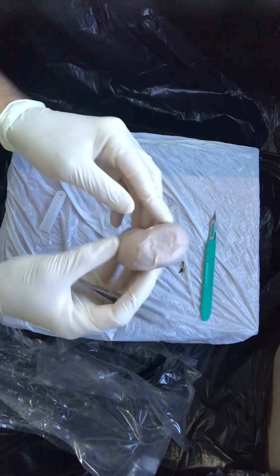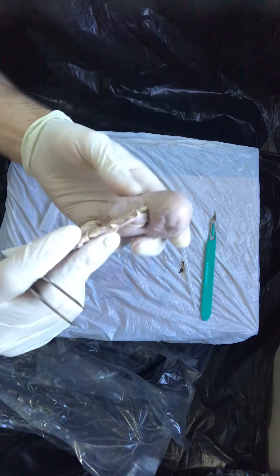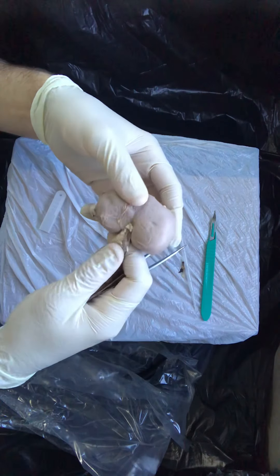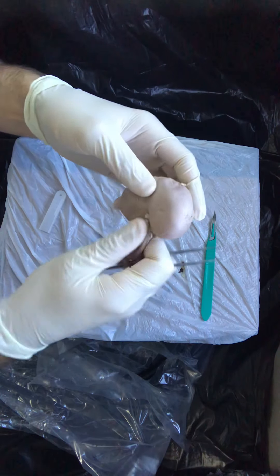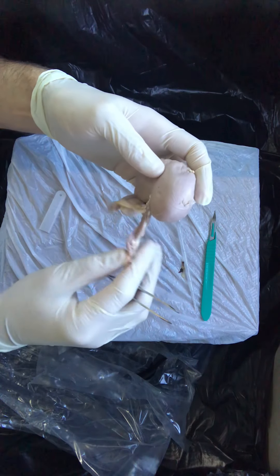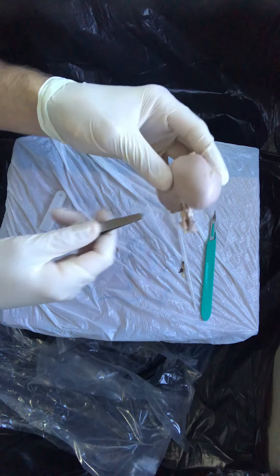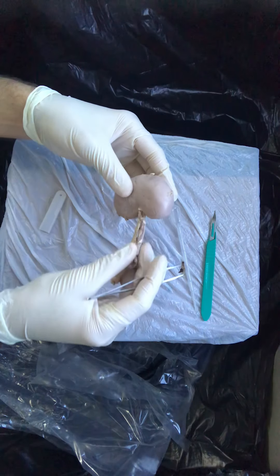As you're inspecting this organ and turning it over in your hands, what I hope that you realize is that there is a specific area on this organ where these hollow structures come and go. These things in my right hand here are going to be the ureter, the renal artery, the renal vein, and they enter and exit the kidney at this region known as the hilum, which is on this medial indentation, this medial surface of the organ.